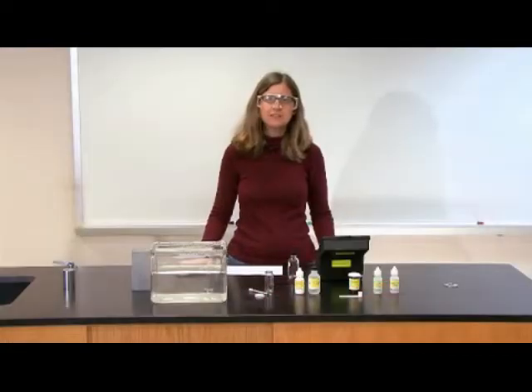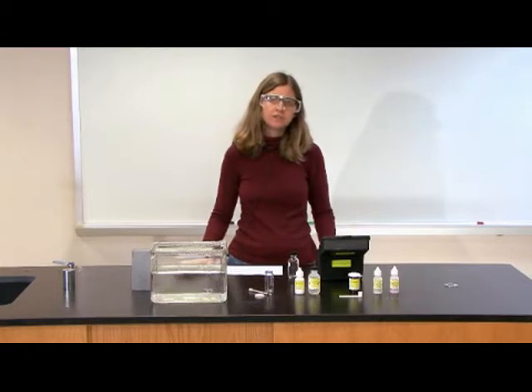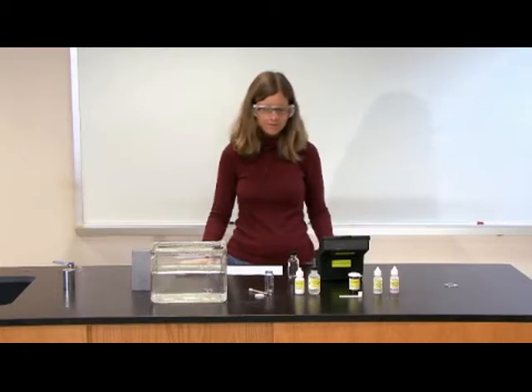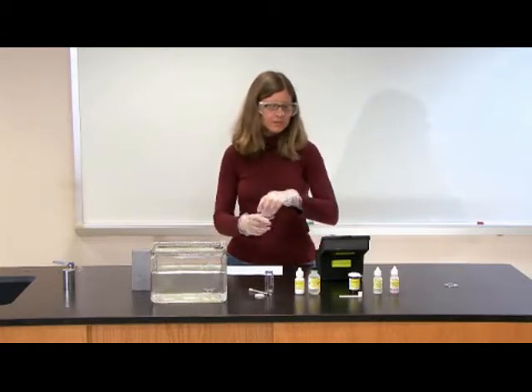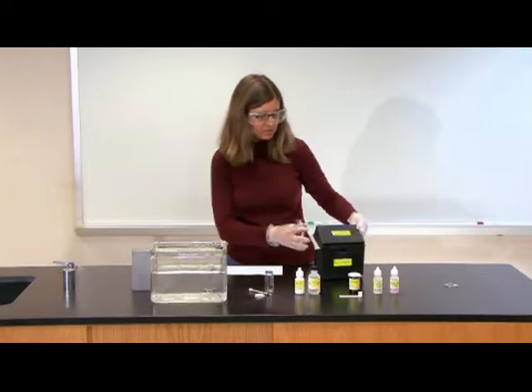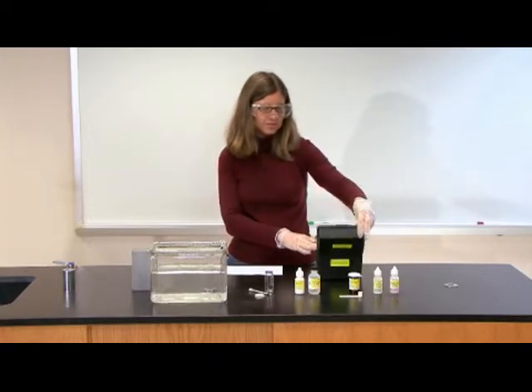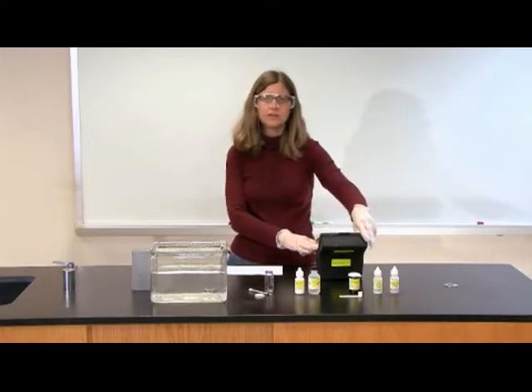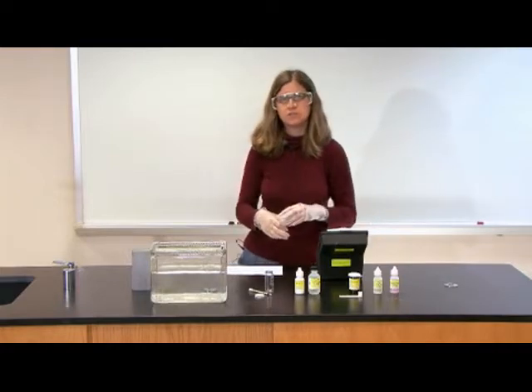Dissolved oxygen is a measure of the concentration of O2 gas in a sample of water. We're going to measure dissolved oxygen using a Lamotte Dissolved Oxygen Test Kit, and this is really one of the most accurate ways to measure dissolved oxygen.